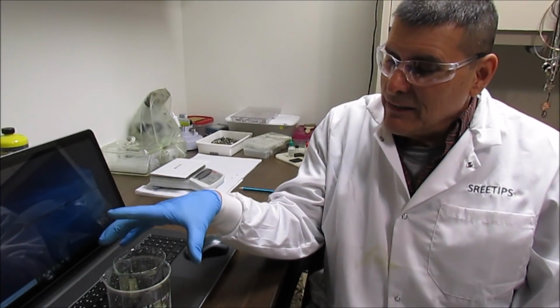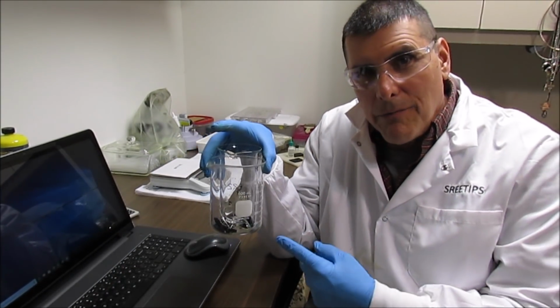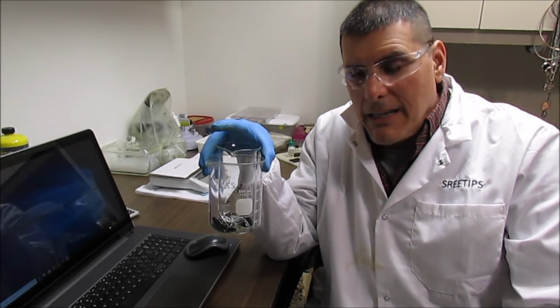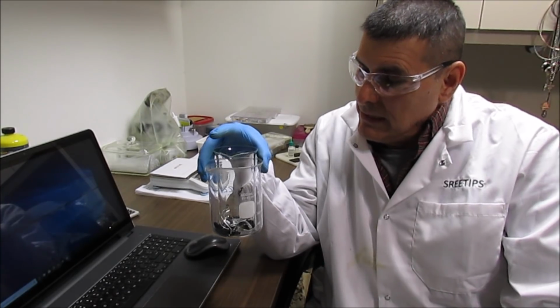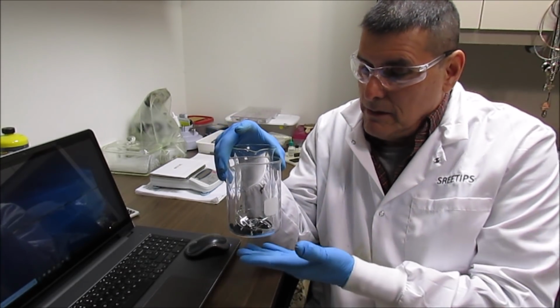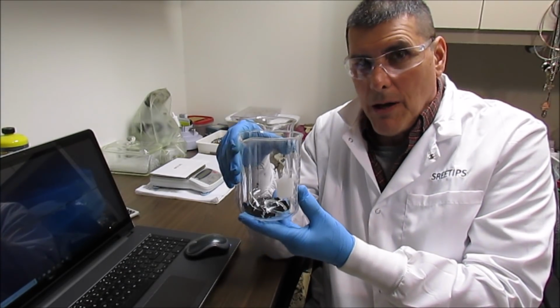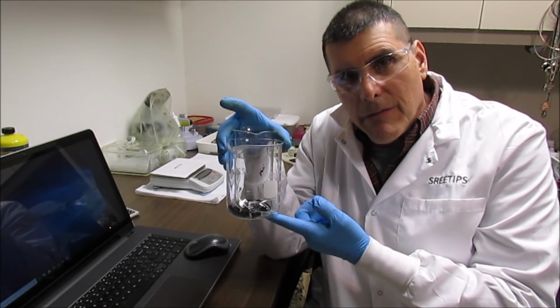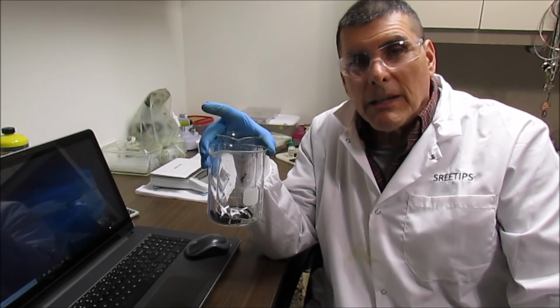Okay, this will conclude part 14 in the stock pot refining series. I've got another mess to clean up. This one shouldn't be that bad. Fortunately, I had a clean dish out there on the heating pad, so it'll just be a matter of getting this all in solution and then getting the bits of glass out of there. No problem. I've only got 7 grams of platinum group metals here, but that's quite all right.